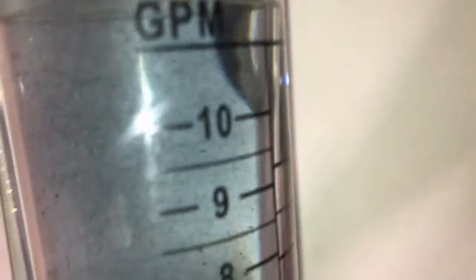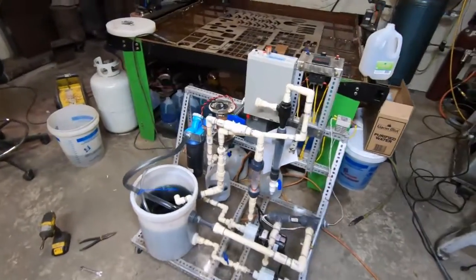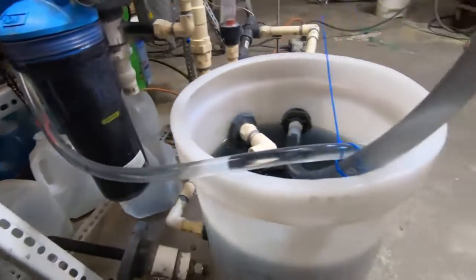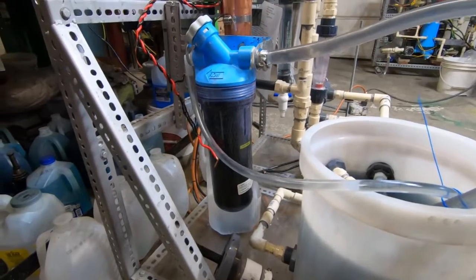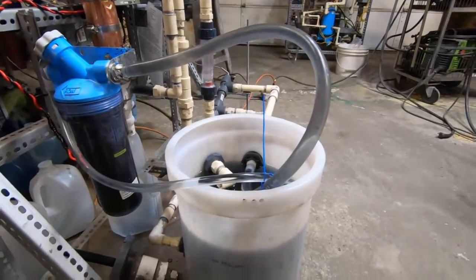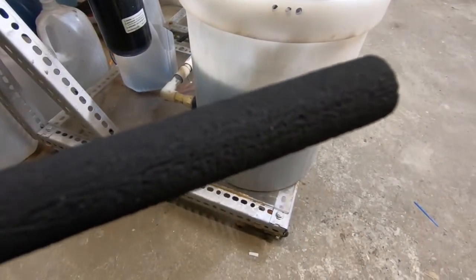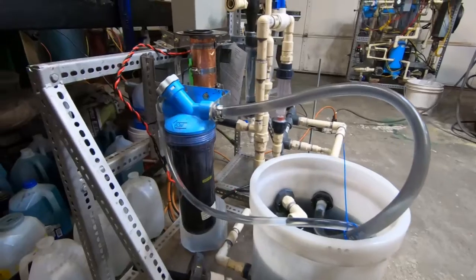This is just not going to work, guys. I'm going to let it run for a little while longer and then shut it down. We are going to reinsert the lead anode — the graphite was a bad deal. I went ahead and hooked up a filter, and I'm going to run this solution through a filter loop for a couple of hours before we resume the test. Hopefully that doesn't botch the test. I'm just going to run it until the fluid clears back up. There's so much contamination from the anode ablation that I feel it could mess up my samples.